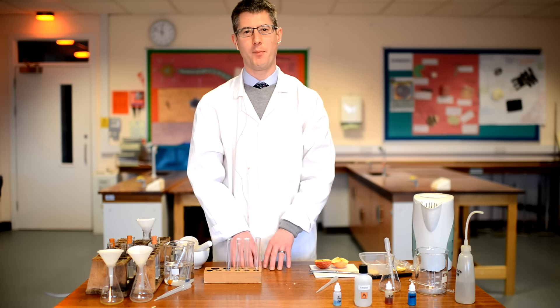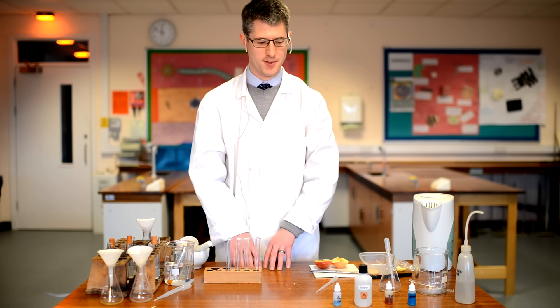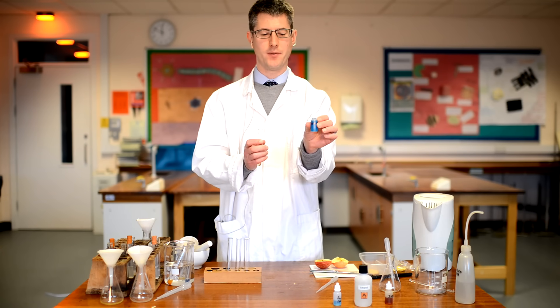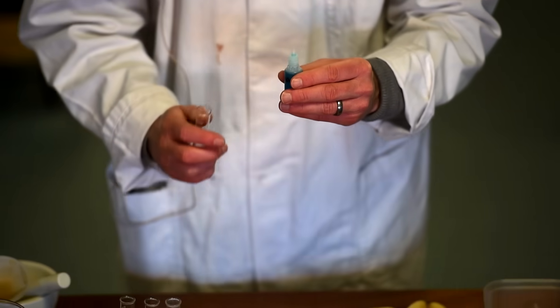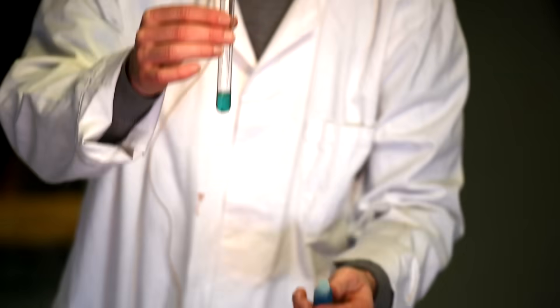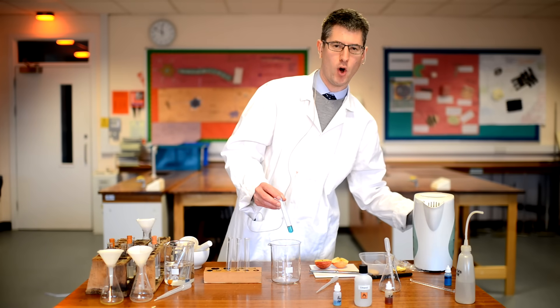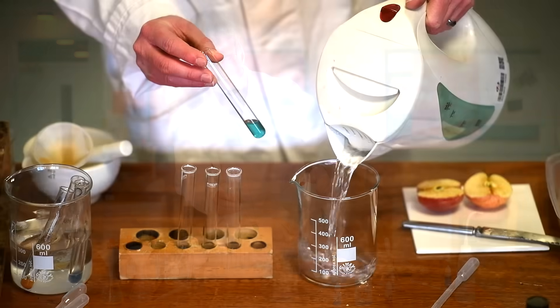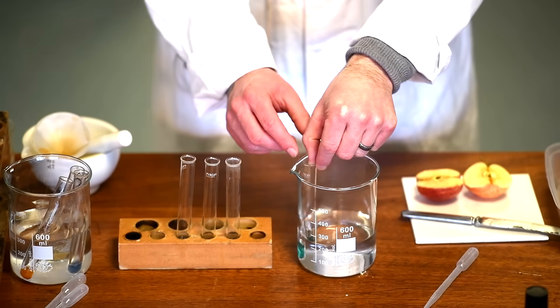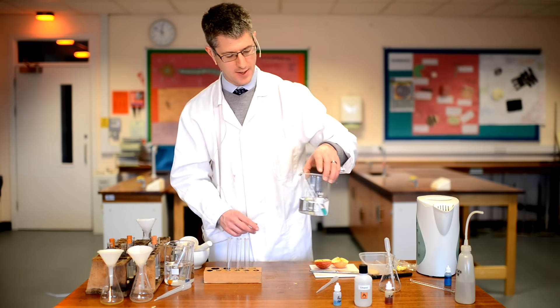The first two tests we're going to do are both for carbohydrates — these are sugars. The first test is for very short carbohydrates such as glucose, and this is called the Benedict's test. We're going to take our first tube of apple solution and add the blue solution of Benedict's reagent. If you're asked about the method in an exam, you add Benedict's solution — it starts as a blue colour — and you then have to place the tube in a hot water bath. You must say the sample needs heating. So you add Benedict's reagent to the food sample and then heat.